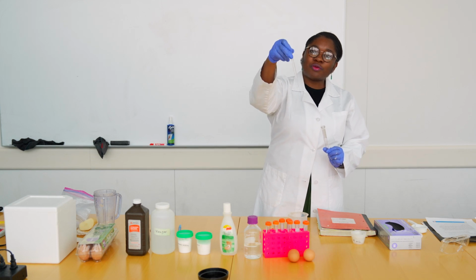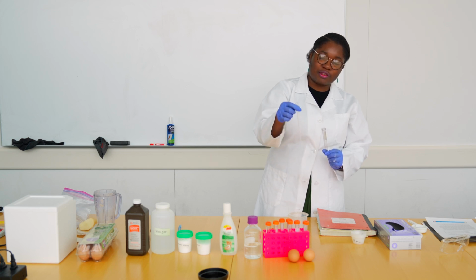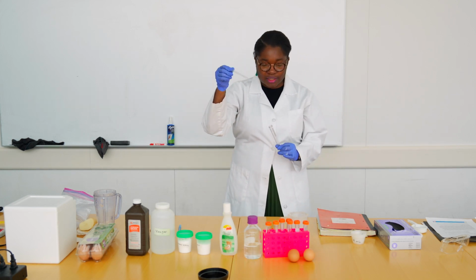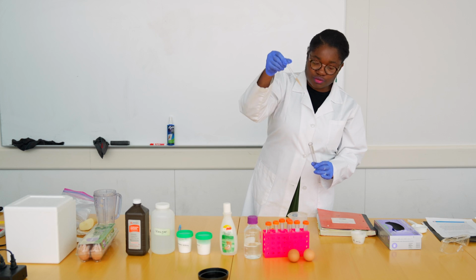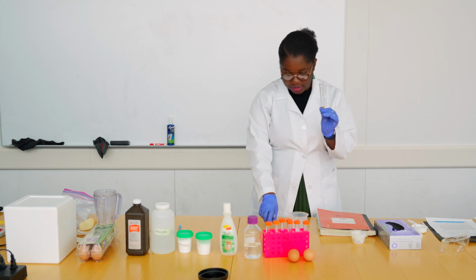And the way this pipette works is that you squeeze the top and put it in your fluid, and as you release, you would see that your fluid is going to get into the pipette. The pipette also has some graduation, so you can see exactly how much you're putting in. So there we are. I don't need to measure it per se, but I need just a couple drops. And release. And there we are, potato juice in the tube.